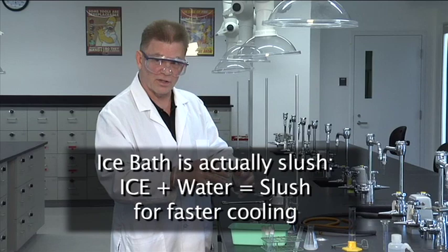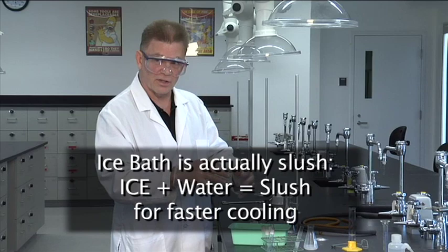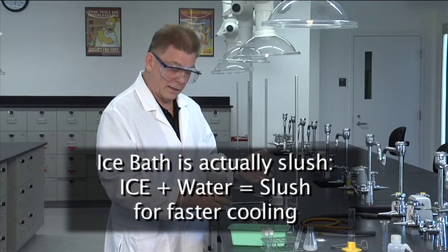then it only gets cold where the ice touches the surface. But if there's a liquid in there, then the liquid is ice cold and it has total surface contact.